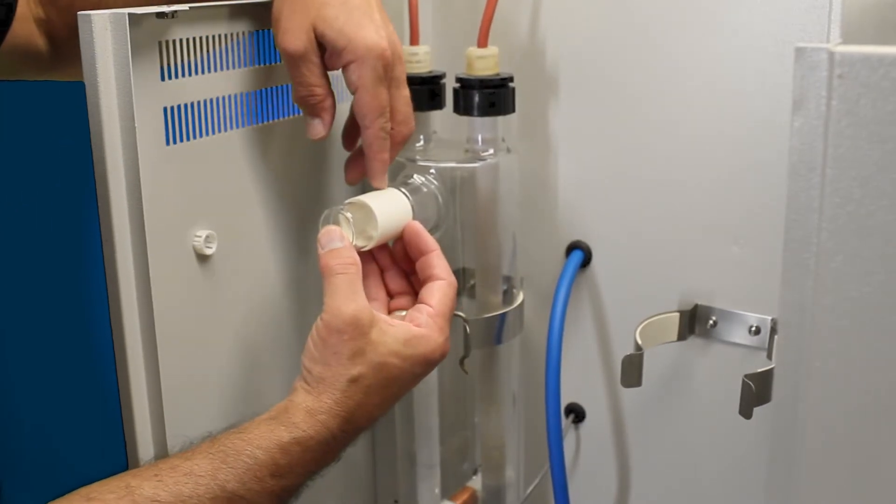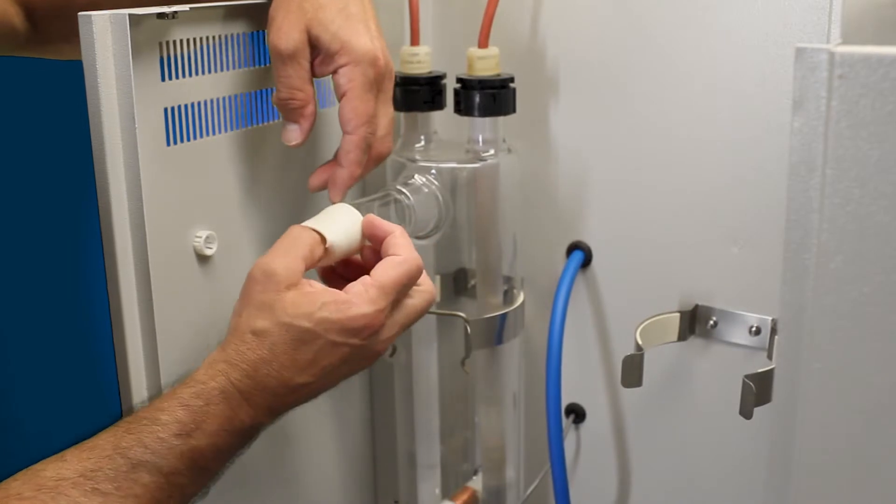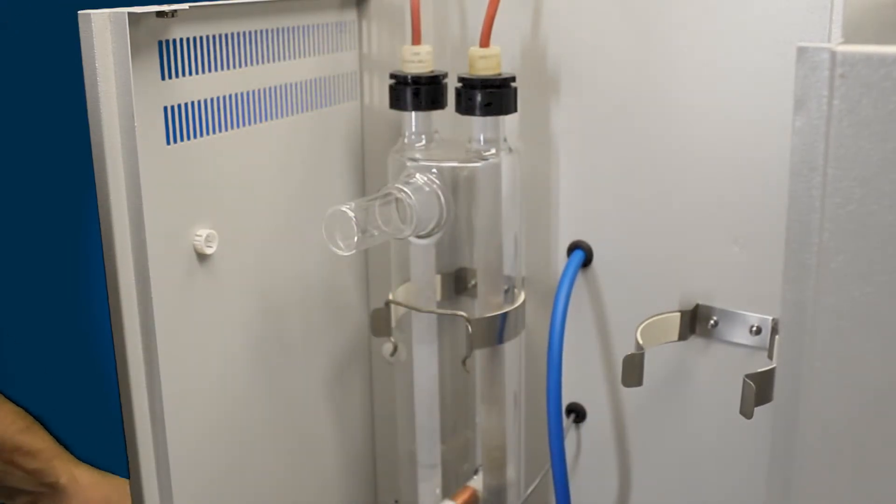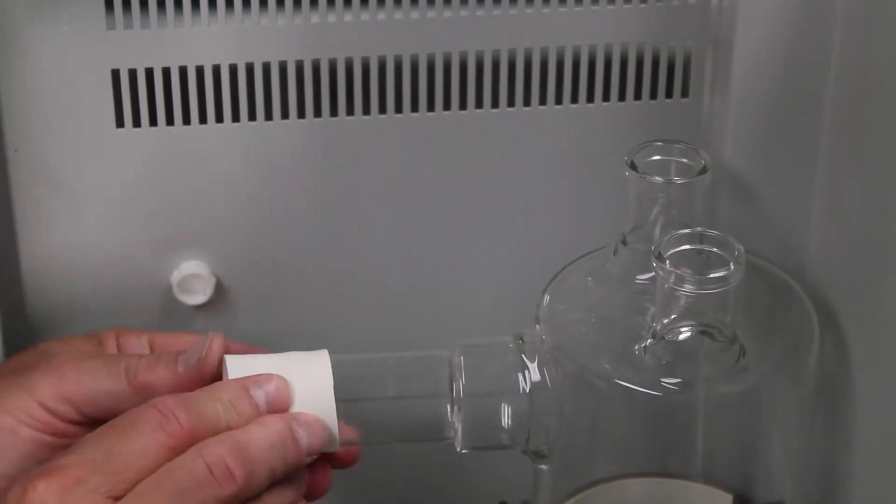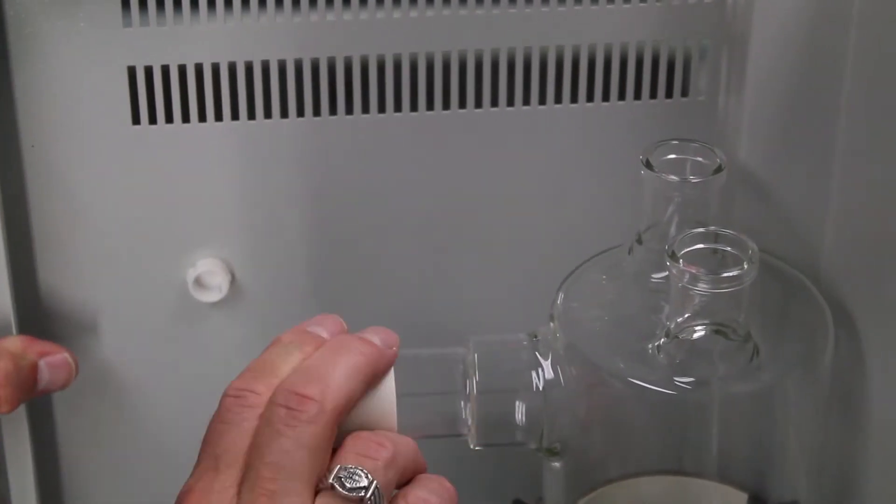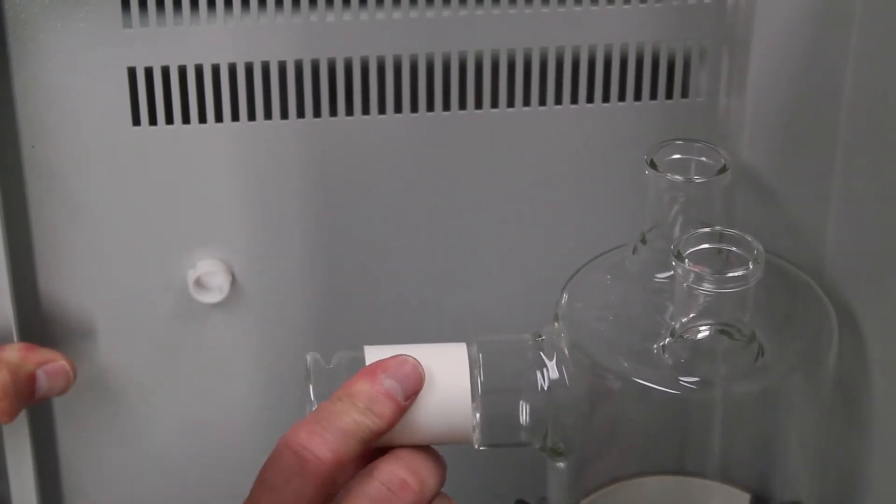Take your sleeve, the inner sleeve for the boiler, which you will get new with the condenser. Remove the old one. Then we're going to go ahead and reinstall the new one. Here's our new sleeve, inner sleeve. Reinstall that until it comes up to this edge. That's as far as it will go. Make sure that this slotted hole is open.